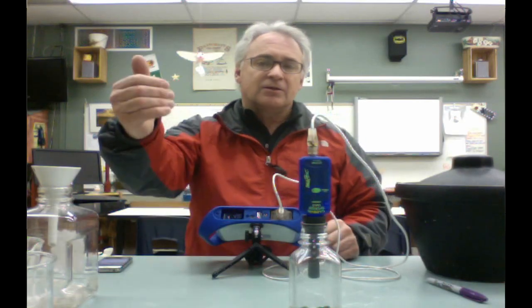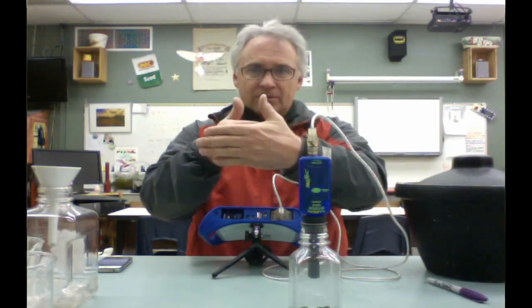But again, what I'm trying to do here is demonstrate to you all the 3 different treatments you're going to do to the seeds. And because of that, it might be easier for you to do the dry dormant ones, then the ones at room temperature that have been soaking in water for 24 hours, and then the cold ones that were soaking for 24 hours. That way you can keep it straight. But if you think you can handle 2 at a time, it'll save you basically 10 minutes, and you'll probably be able to get it done on time.